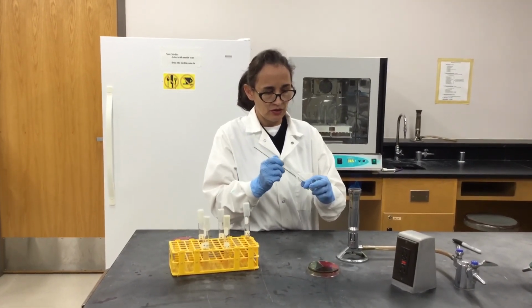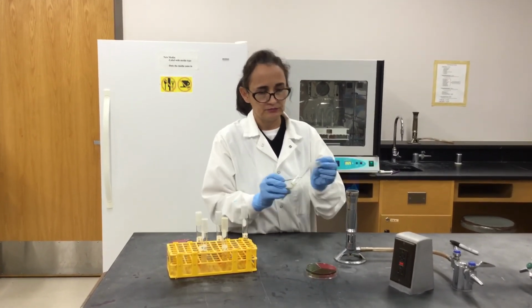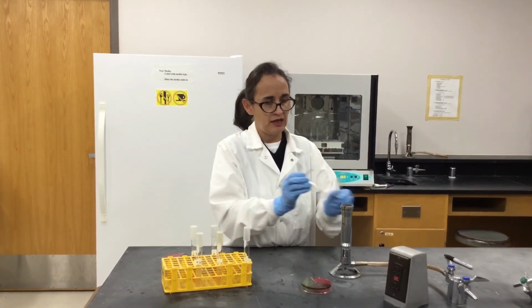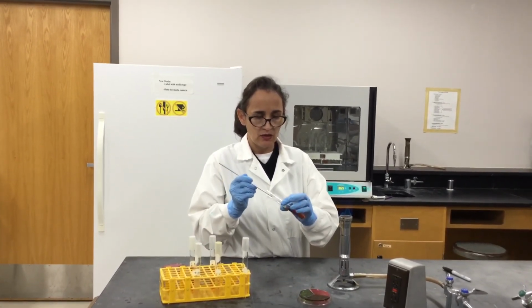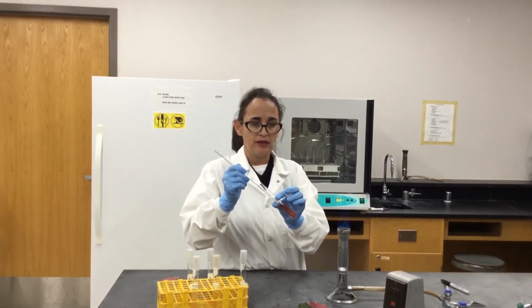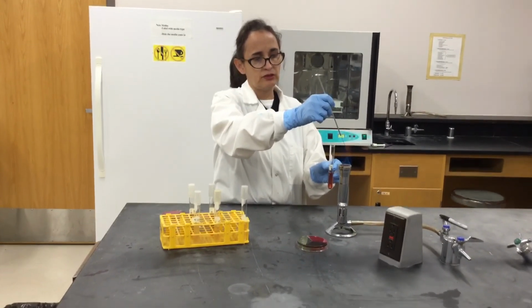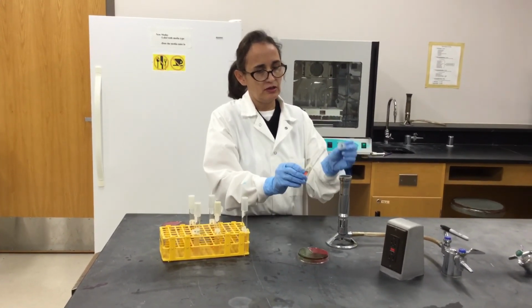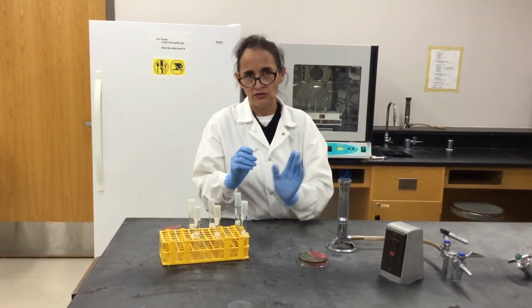So now I'm going to inoculate this broth, just like any other broth. You just grab your inoculum from your culture and then pass the opening of the tube and the cap twice through the flame, and then go into the middle, and of course you will hit this Durham chamber with your loop. But after that, you will sterilize your loop, and then pass your tube and your cap twice through the flame, close it, and then you're done with your aseptic technique.